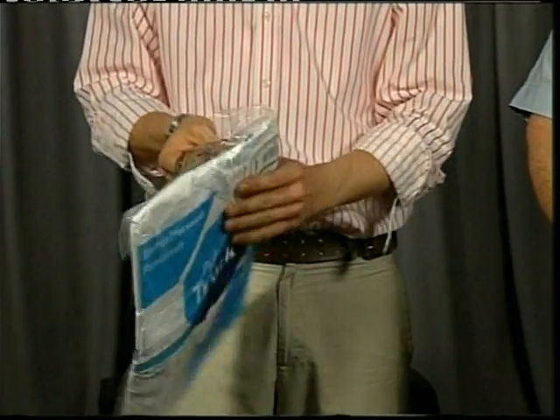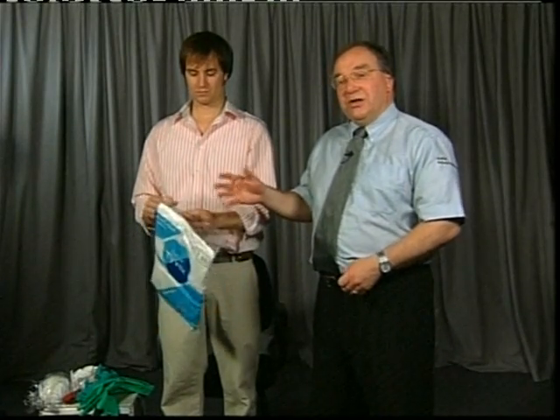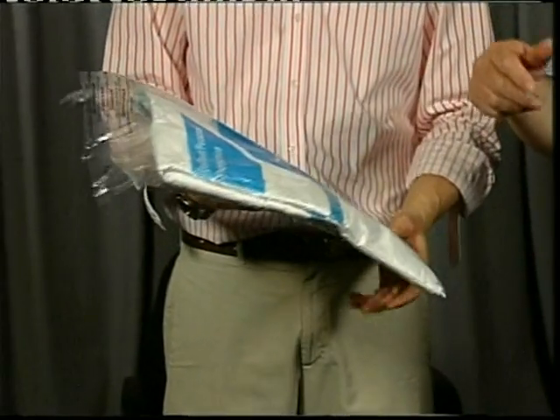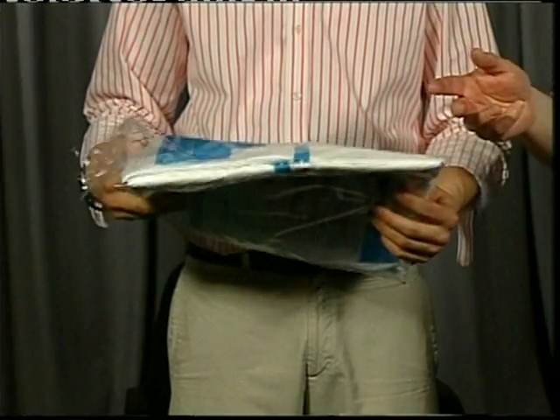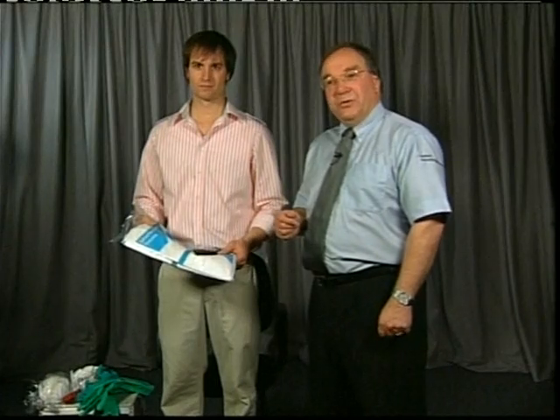The main thing we have to make sure of before we even start putting on the suit is that it is the right size. We have checked Chapman's height and chest measurement and this suit will fit him. Size is very important — you wouldn't give somebody one size of footwear for all your people. The same applies to the coverall; it should fit the right size of the person.